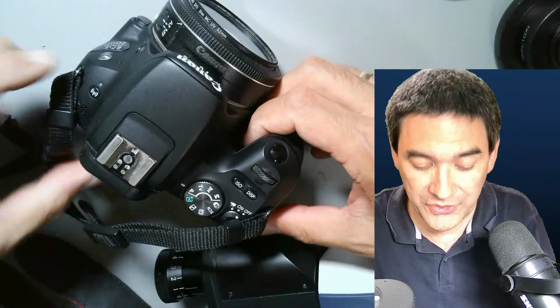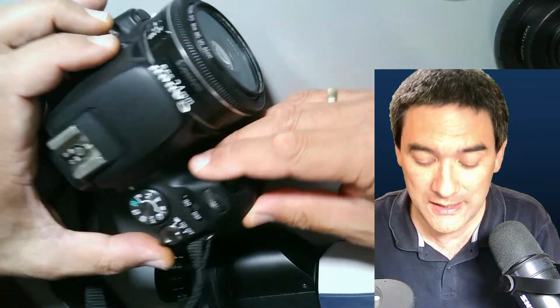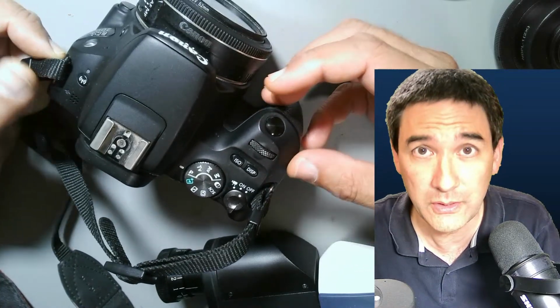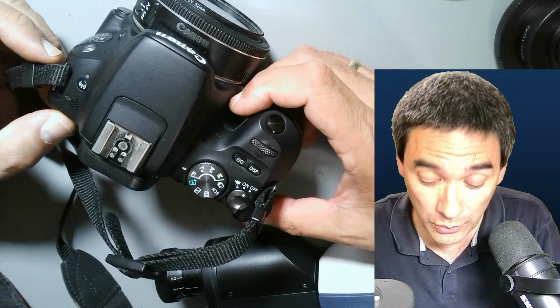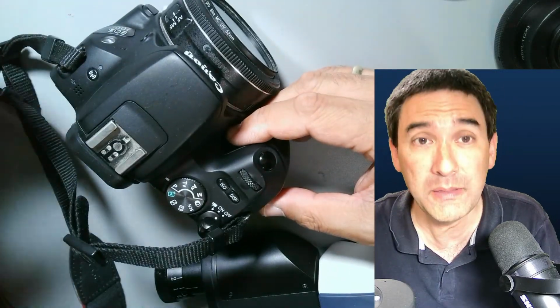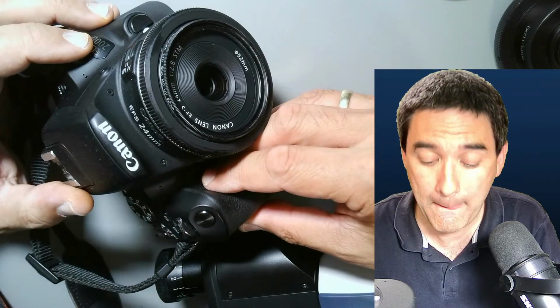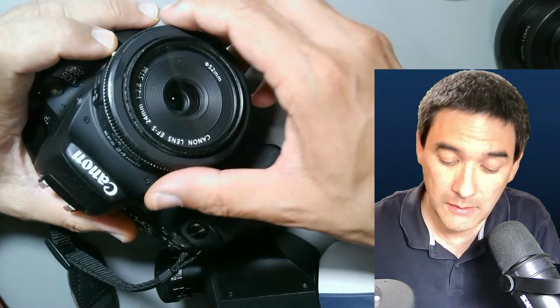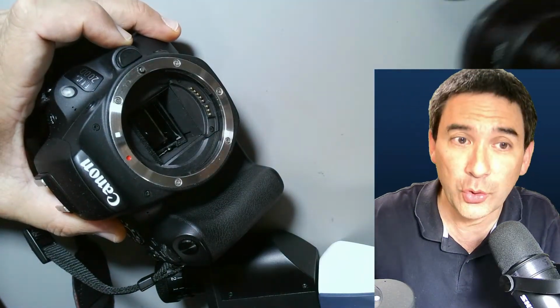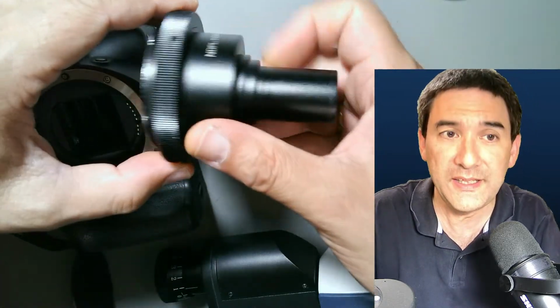Those cameras have a couple of advantages, and a whole bunch of disadvantages as well. One of the advantages is that you can do movies, quite good videos. USB cameras are a little bit slow to do that. The image quality is quite high, the sensor is large, and some people might already have one of those at home. The only question is how do I connect it? I already made a whole bunch of videos, but the most common way, the one that I always showed you up to this point, is that you connect an adapter over here. This adapter looks like this.